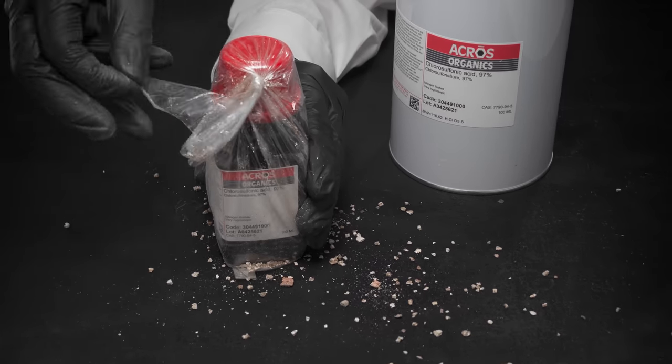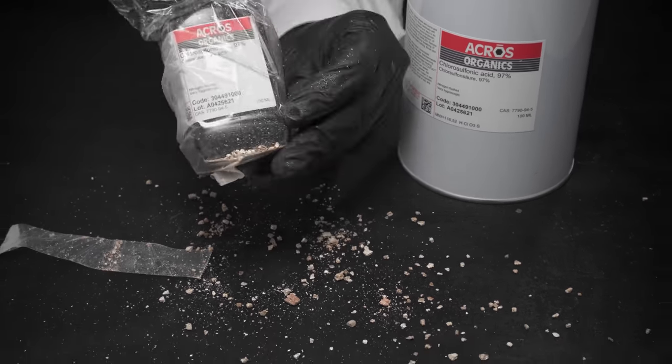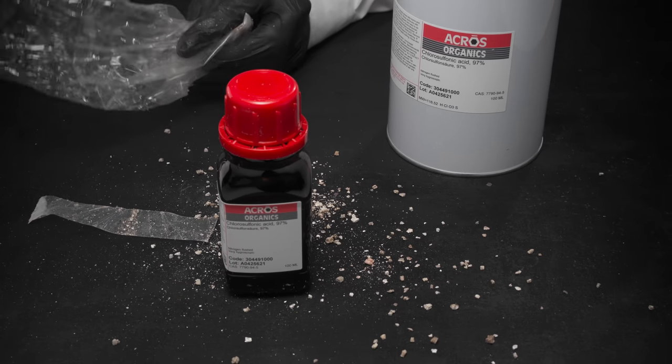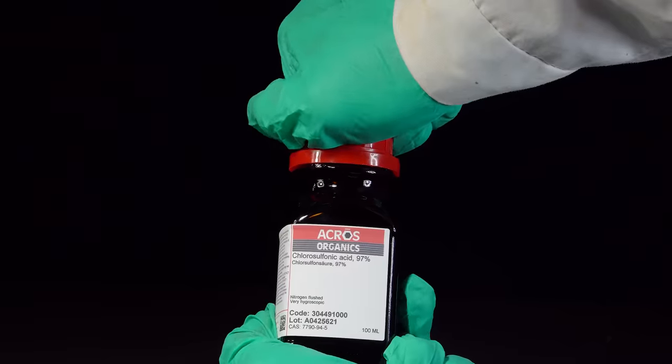Hey guys! In today's video I'm going to show you a few reactions with chlorosulfonic acid, which you may also call chlorosulfuric acid, and that won't count as a mistake. This superacid is much weaker and cheaper than fluorosulfonic acid.